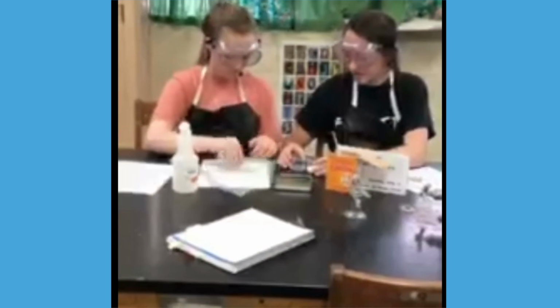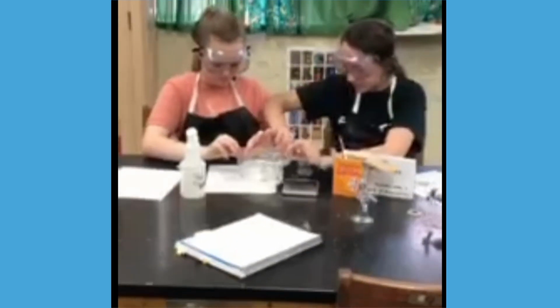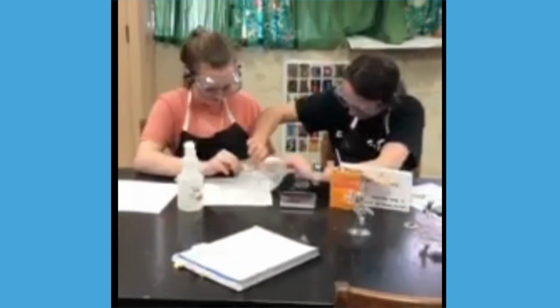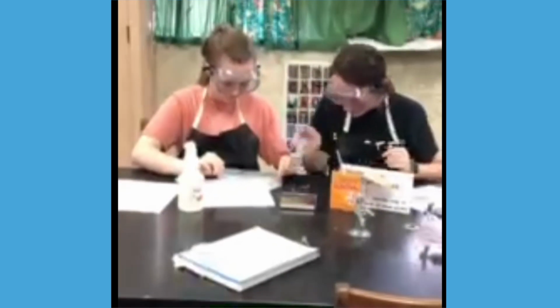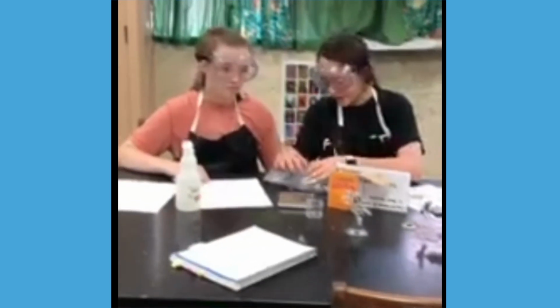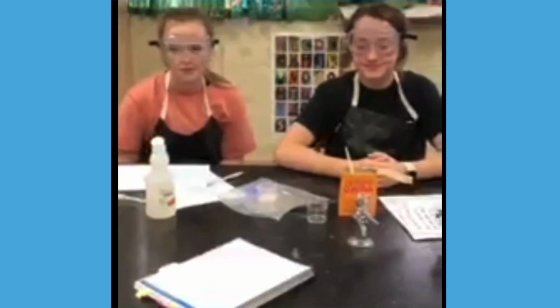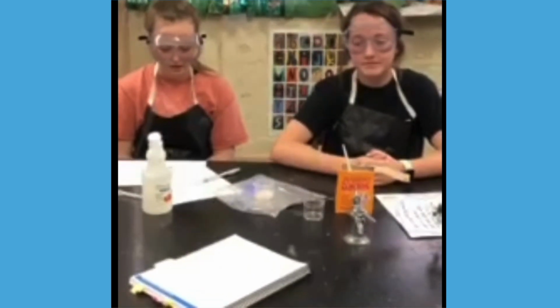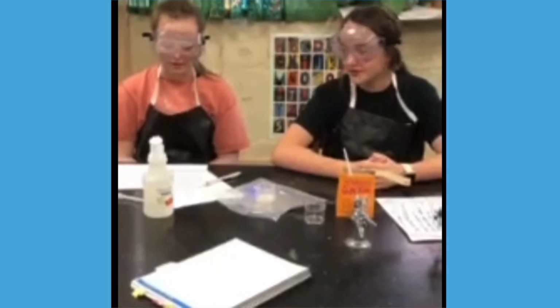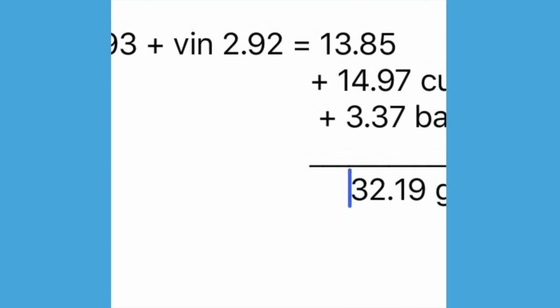So now, get the bag ready. So now we're going to measure this all together. So we added our vinegar and baking soda and got 13.85. Then we added 13.85 to the cup, which is 14.97, and bag, that is 3.37, and got 32.19. And that's what we got for our final mass. So our conclusion is that the law of conservation of mass is correct.